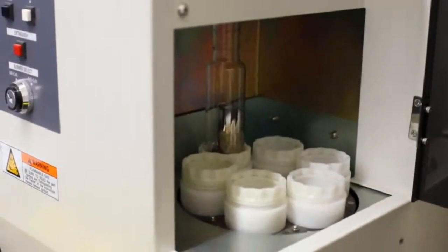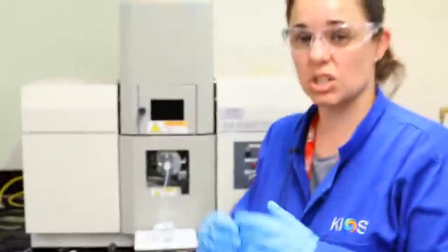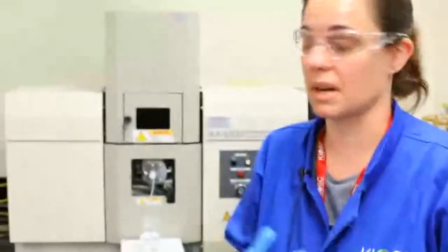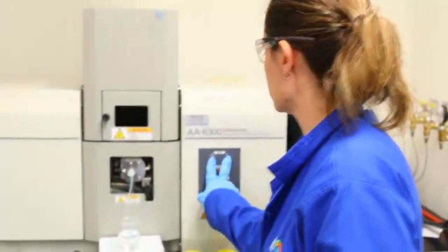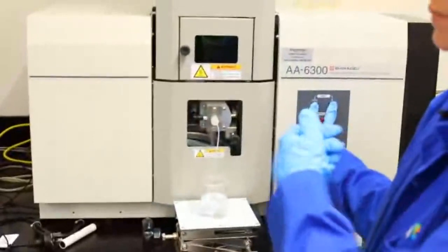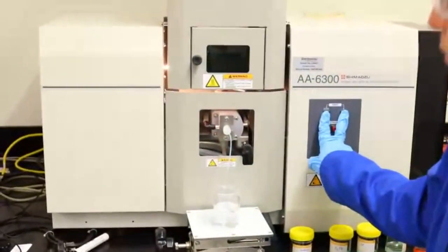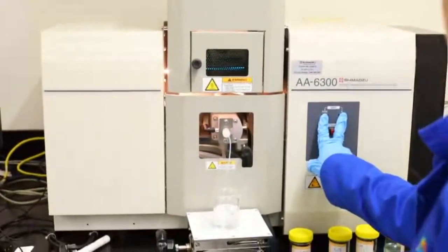From there we can make our calibration curves to work out how much of that particular compound is present. You can also use it just to identify what metals are present. So the first thing we're going to do is light this. Of course, when you get your detection, you have your computer over here that tells you what amounts there are.